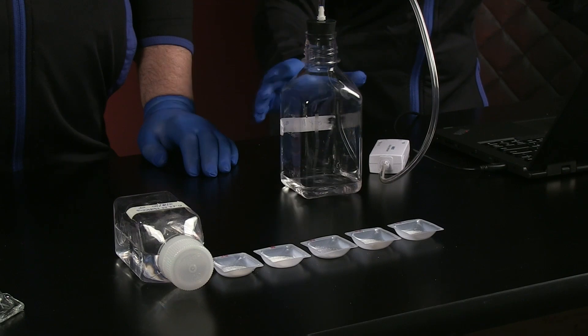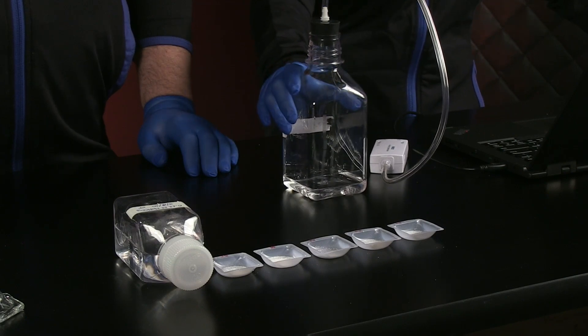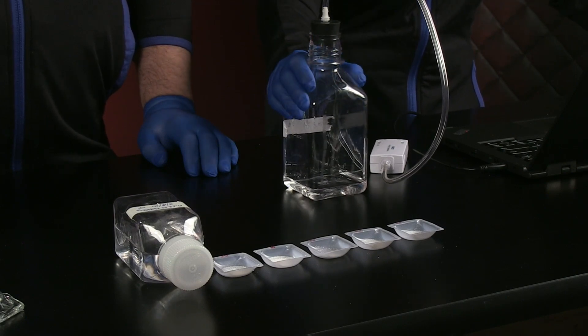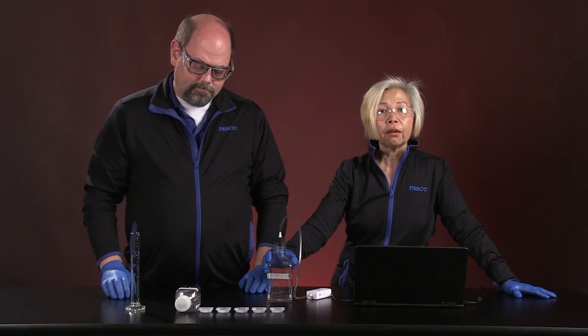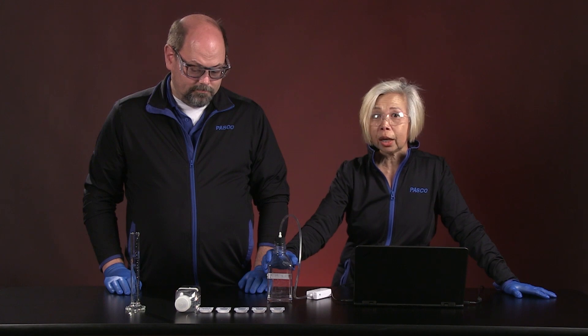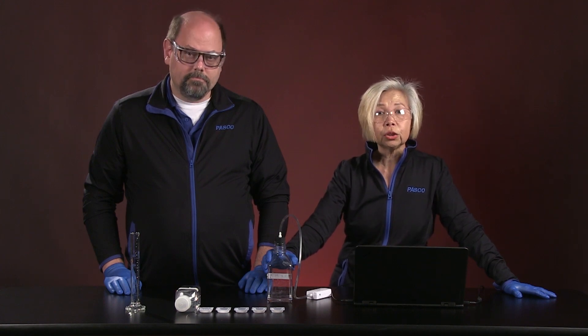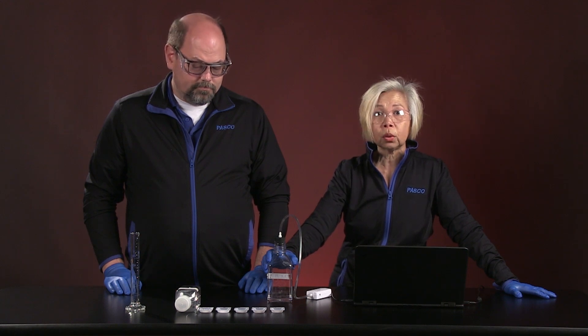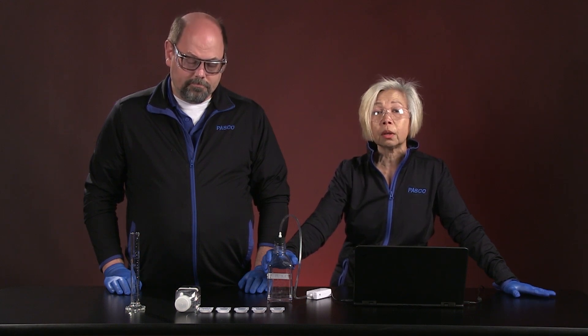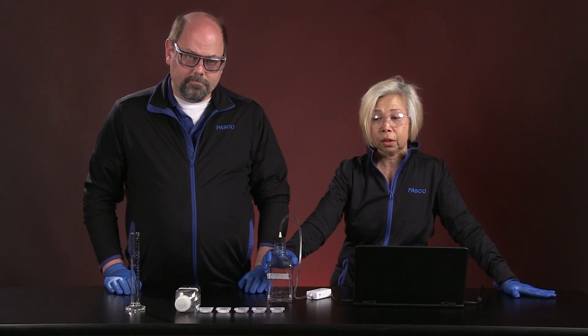We have a chamber, a 500-milliliter chamber, that has 40 milliliters of sodium bicarbonate in it. In every single one of these runs, we will not change the volume of sodium bicarbonate. Your job is to be able to determine how many moles of sodium bicarbonate are being used in every single one of these runs.